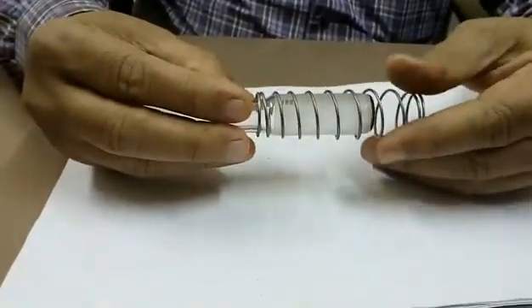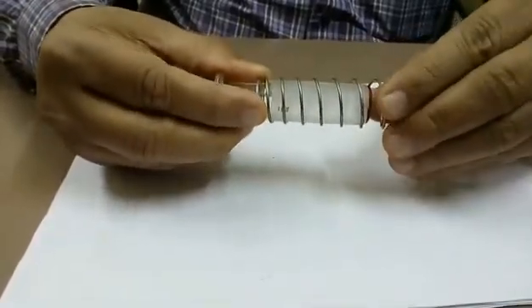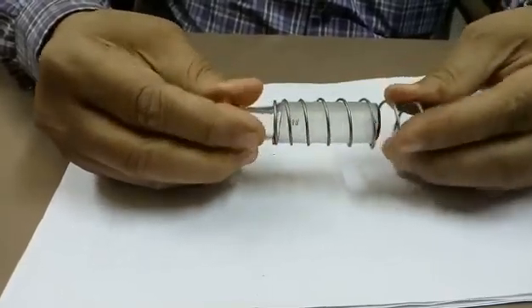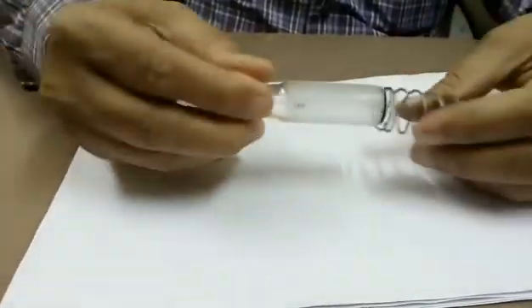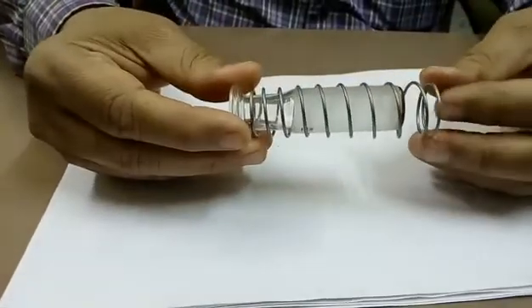Now you observe, when I rotate clockwise the spring diameter increases, and when I rotate anti-clockwise the spring diameter reduces. So to remove the spring, rotate clockwise and pull, it will come out. Similarly, rotate clockwise and push, you can insert the plunger in the spring.